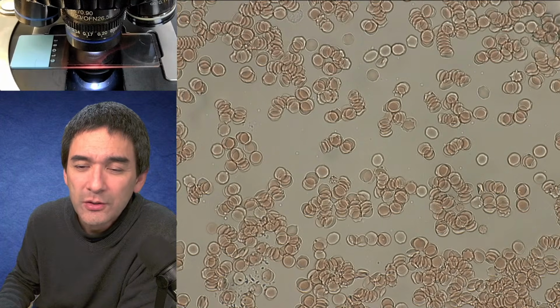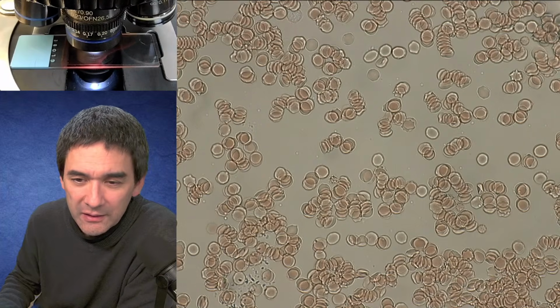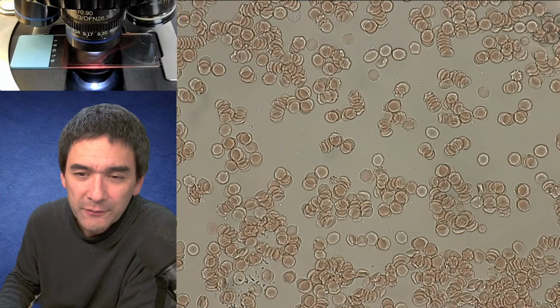It's not directly comparable with a microscope with a light from below and another one from above. That's correct. There is of course also a huge price difference.